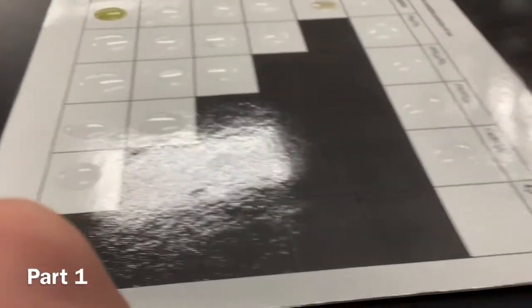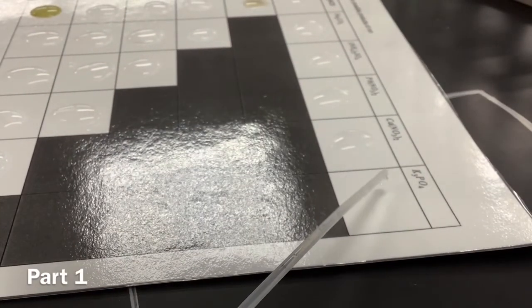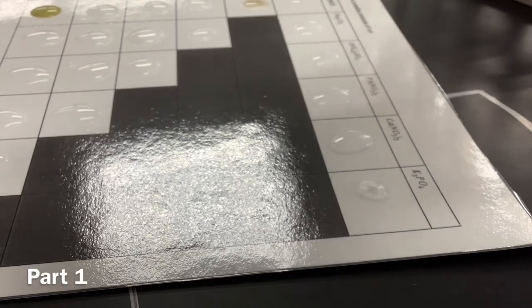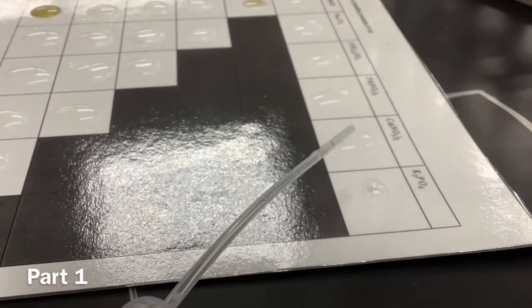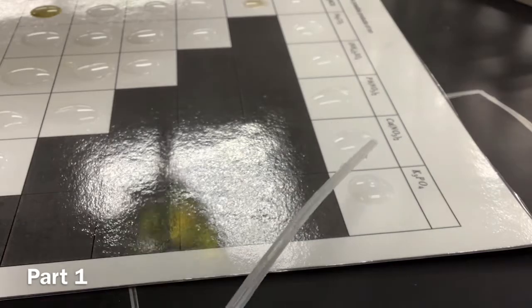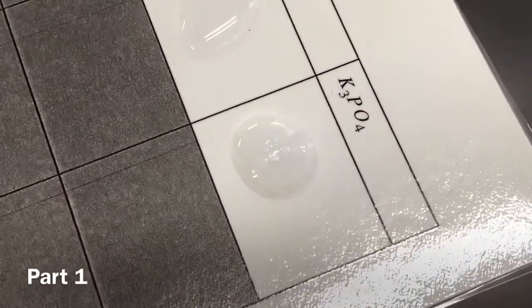All right, we just got one more. Last one. This one's gonna become like a neon orange. I'm calling it right now. If it's not, I'm gonna just turn the video off. Except I get paid for this. Oh, no, it's just white and cloudy. Oh, but that's an above average cloud.